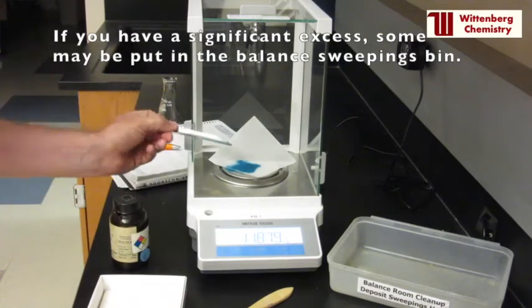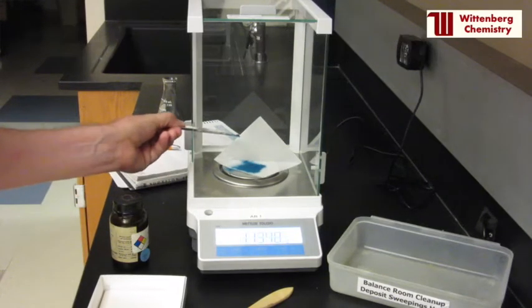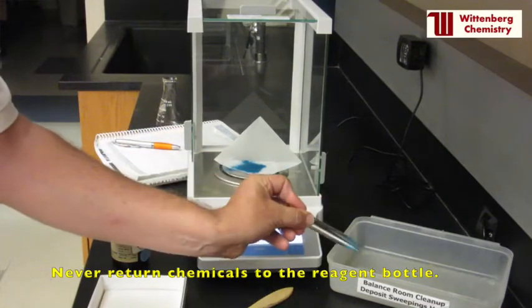If you have taken significantly more reagent than needed, put the excess in the sweeping bin. Never return reagents to the bottle as they may be contaminated.